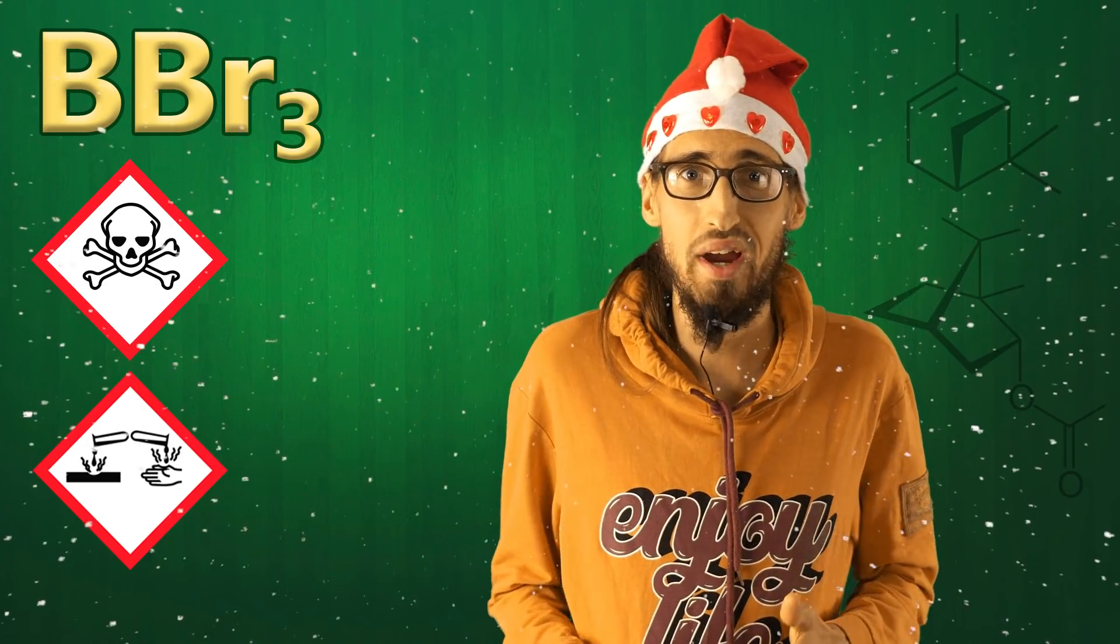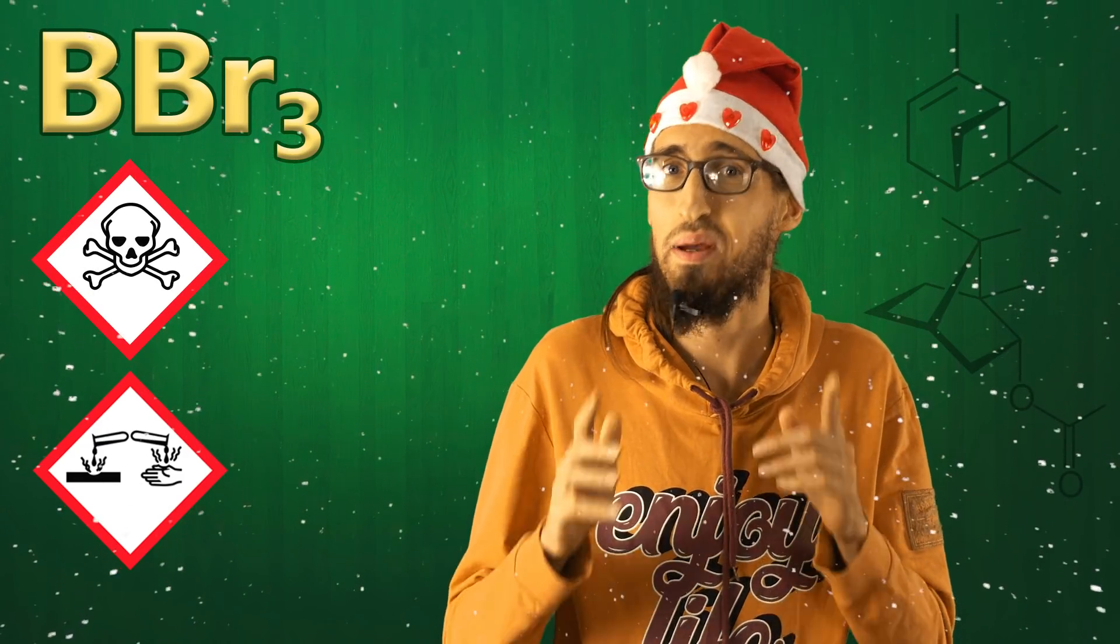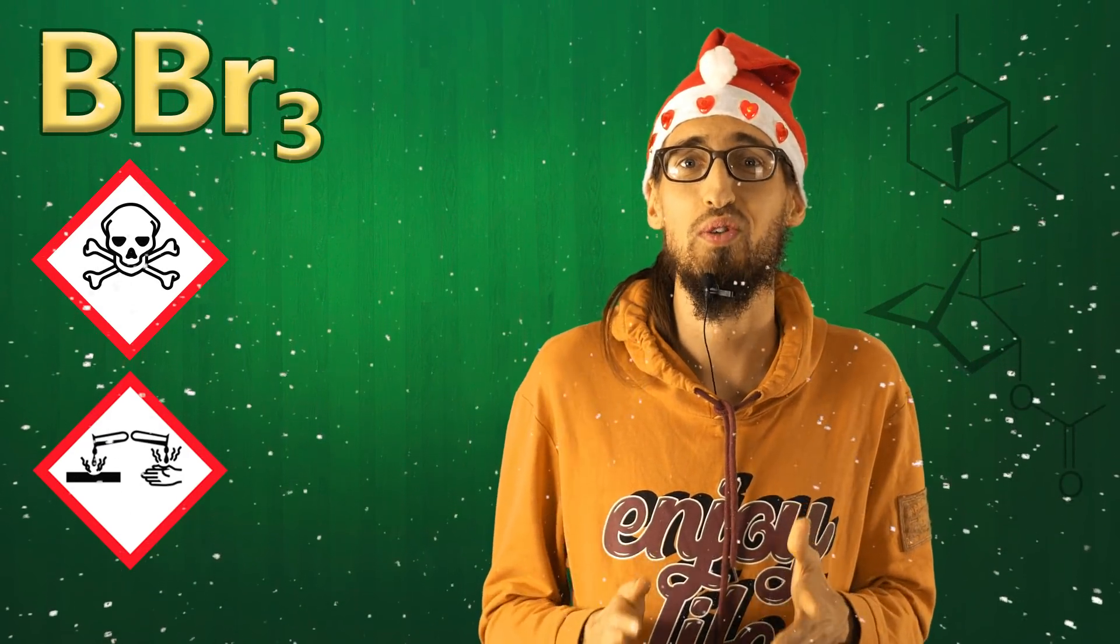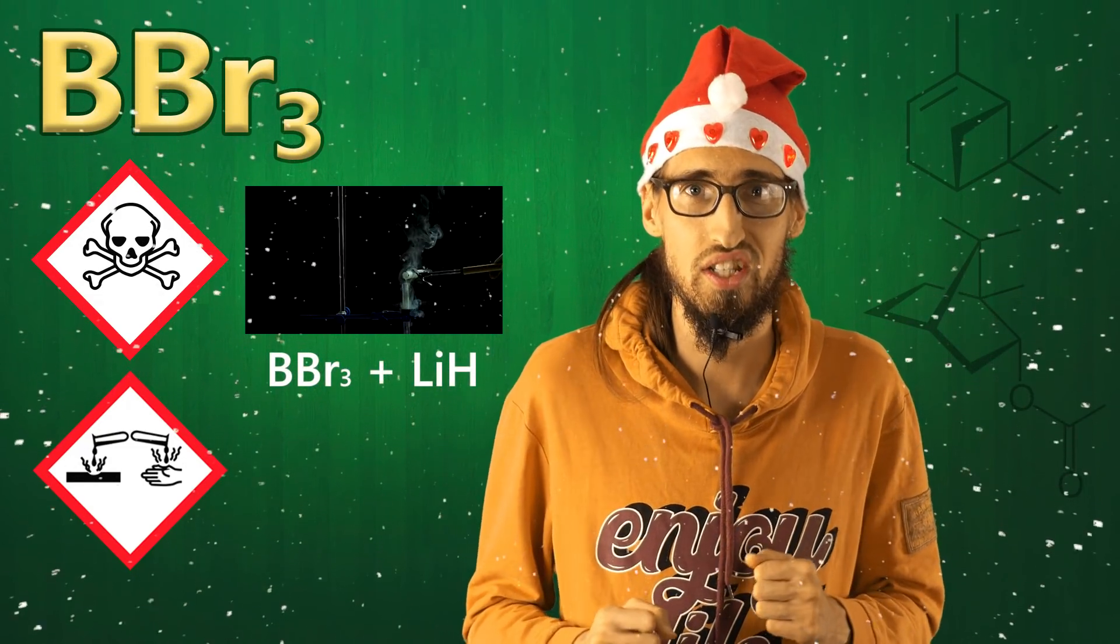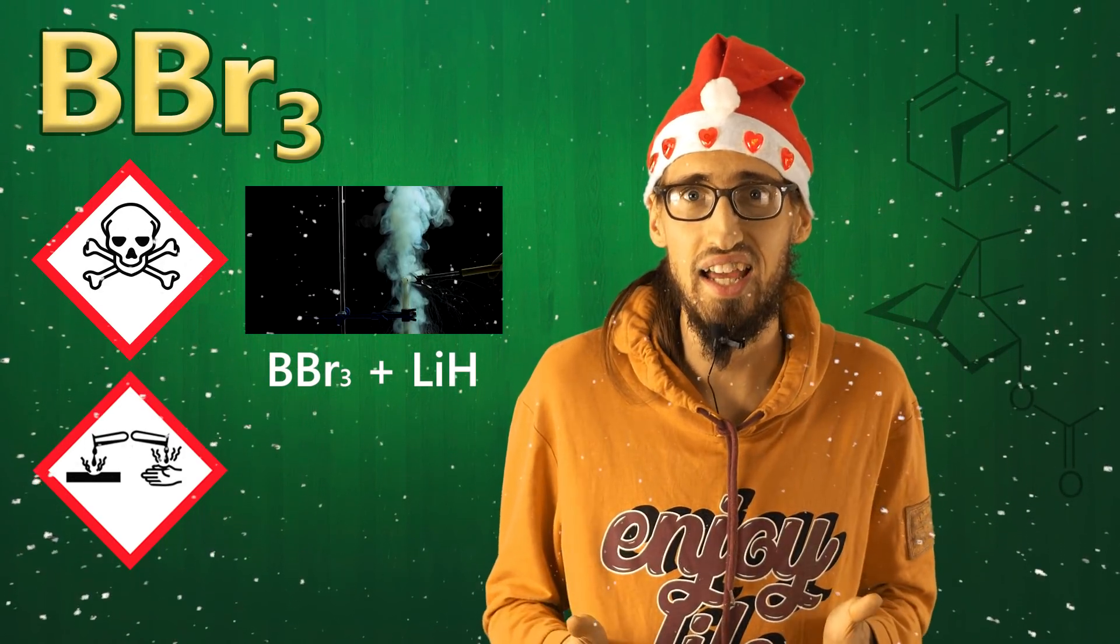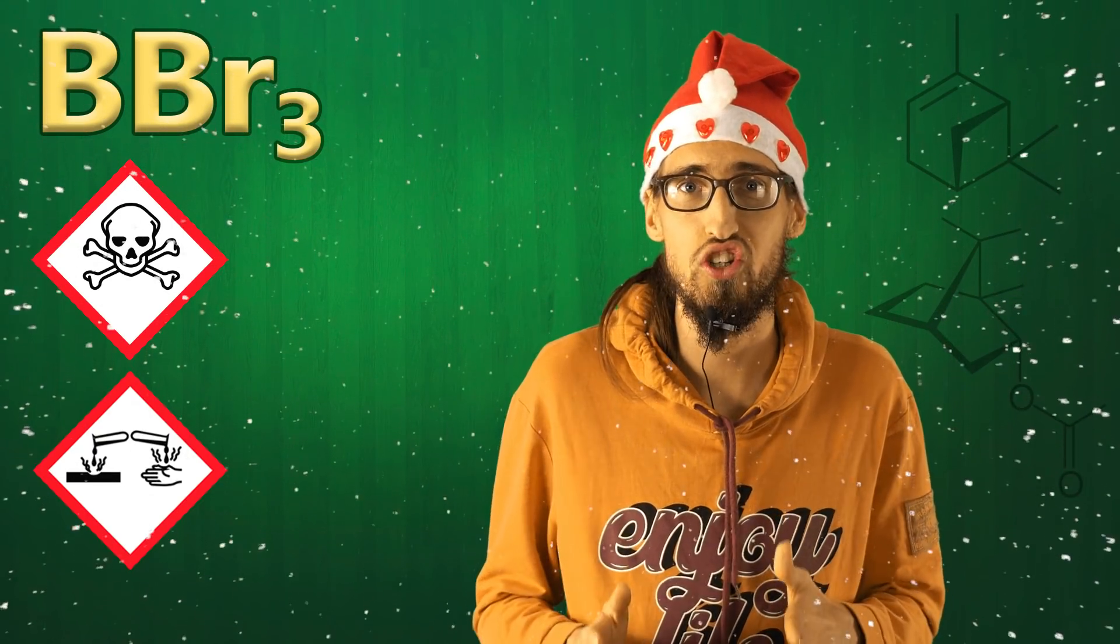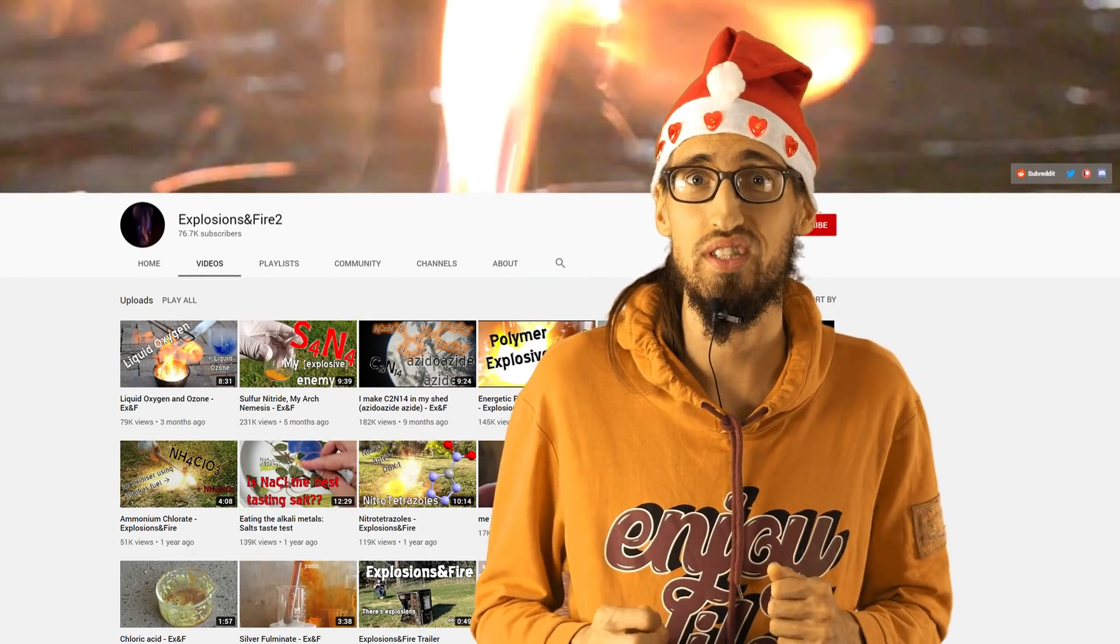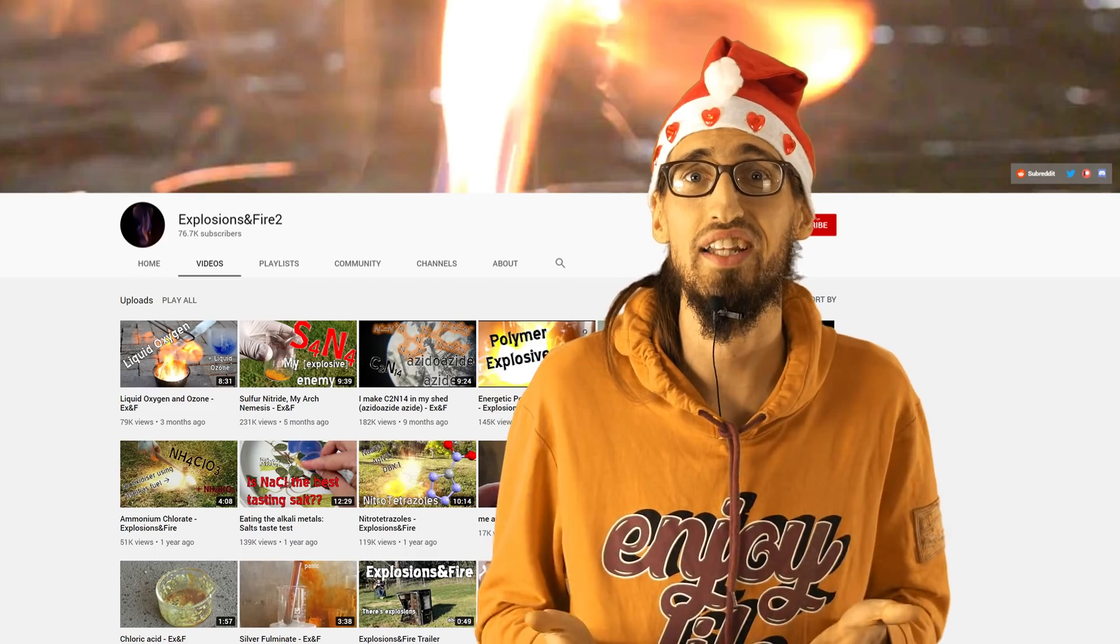Yeah, boron tribromide is a really cool reagent and I have made another very cool reaction with it that I'm absolutely sure you haven't seen anywhere else. This is a reaction between boron tribromide and molten lithium hydride. In this reaction lithium hydride reduces boron tribromide to poisonous gas that self-ignites on air, diborane. I kindly presented all the footages with this reaction to my colleague ChemTuber Tom from Explosions and Fire channel.